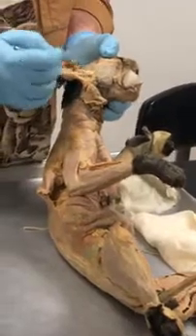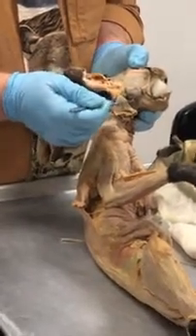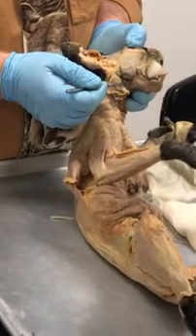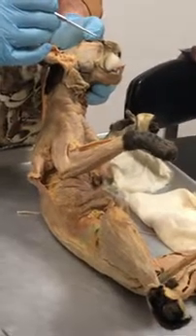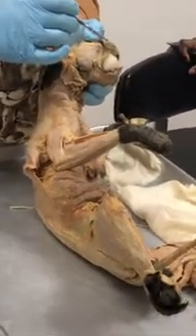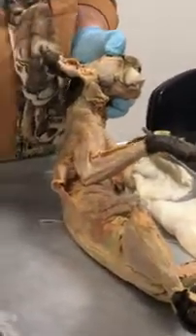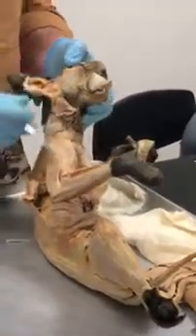Both of these muscles, the temporalis and the masseter, are going to insert into the jaw, the mandible. What is their action? Be specific. Elevate. It is going to close or elevate the mandible. If you put down chewing, that's too vague. Are you talking about opening or closing the jaw? You have to be precise.